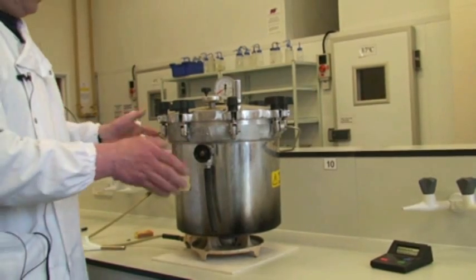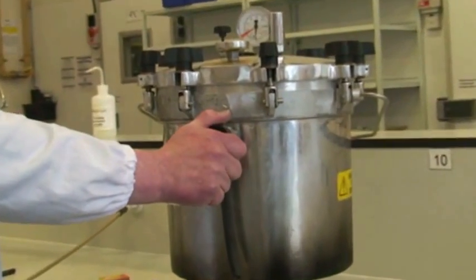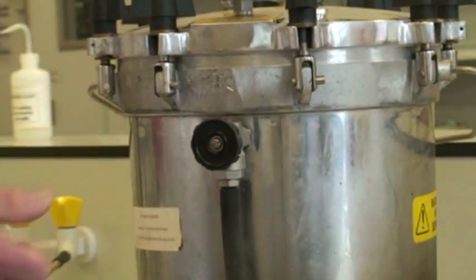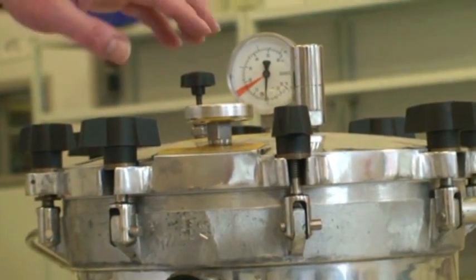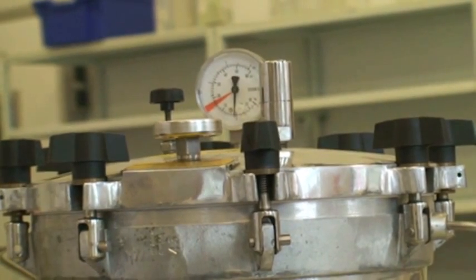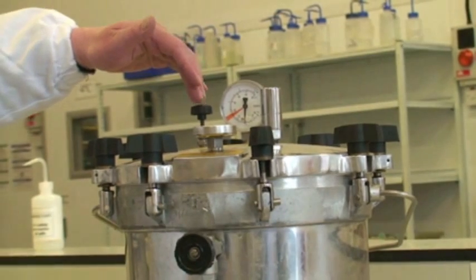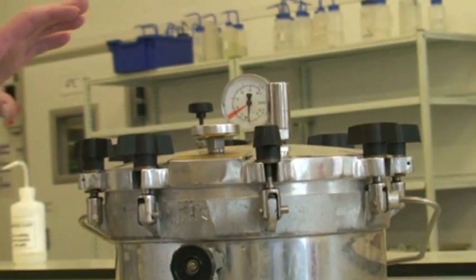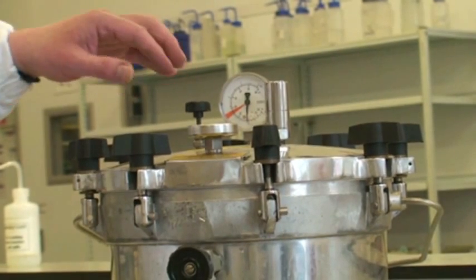Once you've started the gas, you must make sure this water valve is closed and this valve is open. This is to vent the air out as the autoclave heats up. The air will be vented out of this valve to ensure that there's steam to sterilize whatever you've got in your autoclave.